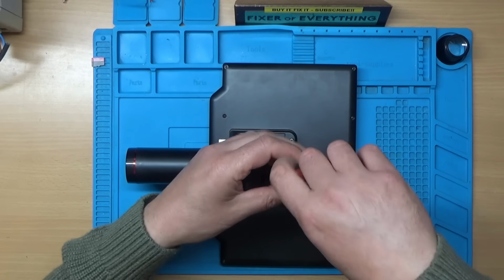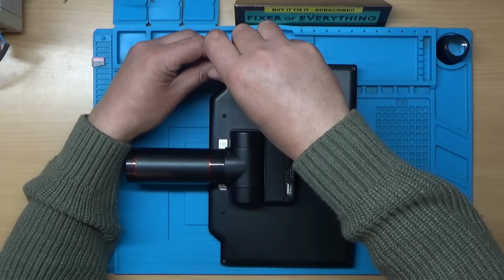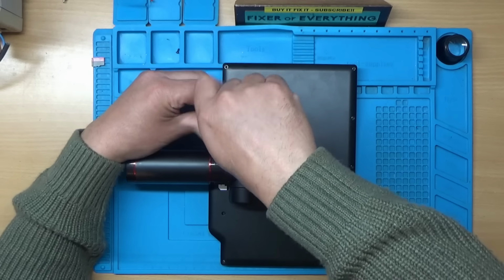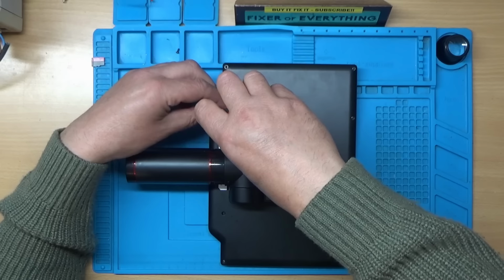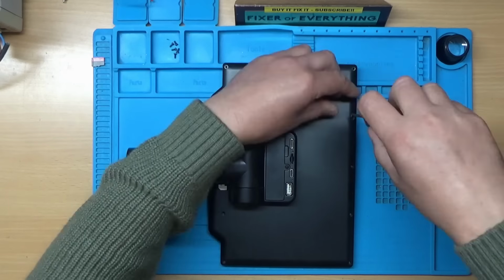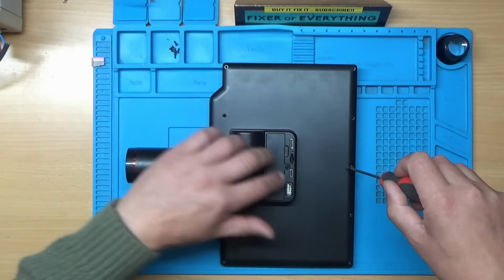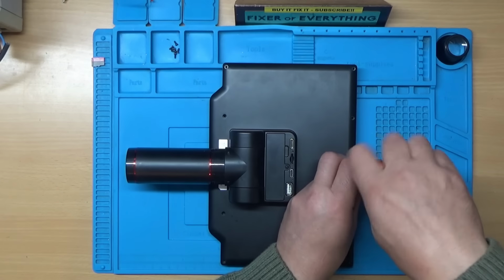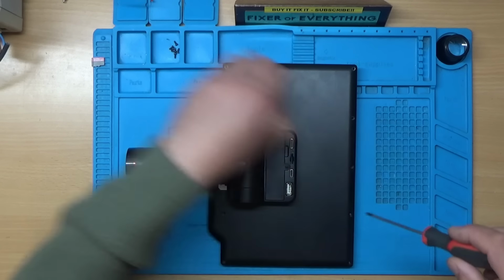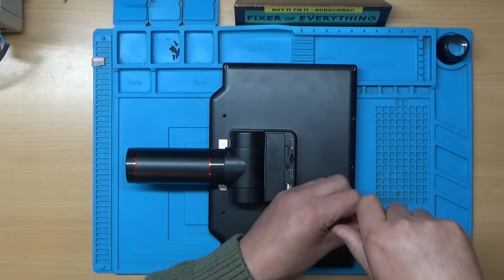So one thing that we've got to be mindful of when we're taking it apart is that it might have power going to various parts of the board. So I'm going to remove these screws around the outside first. I've never used the USB socket on the back here because I just used the USB-C socket for the power adapter. So perhaps you can save to an external flash drive or something as well. Might be something I'll have to have a look into.